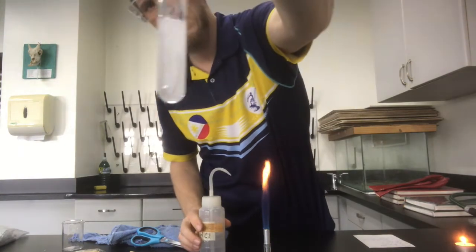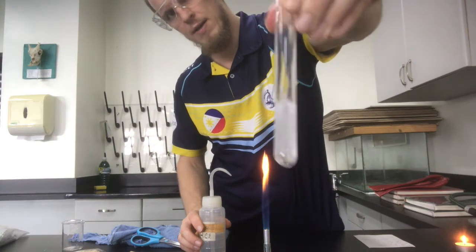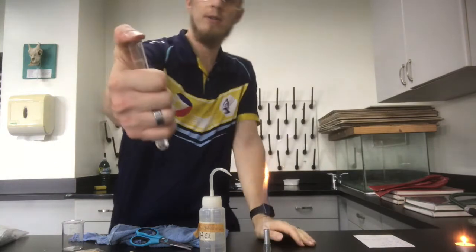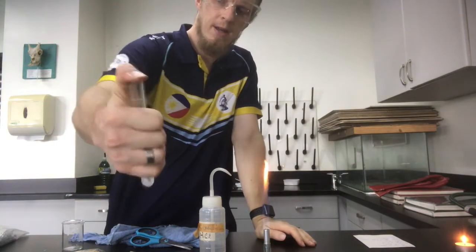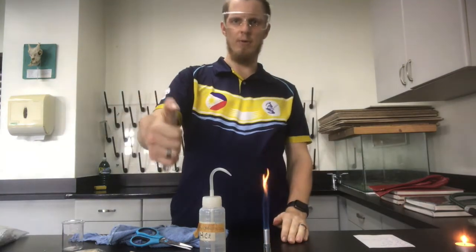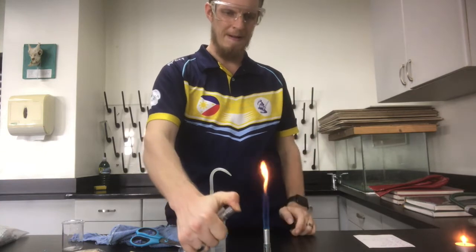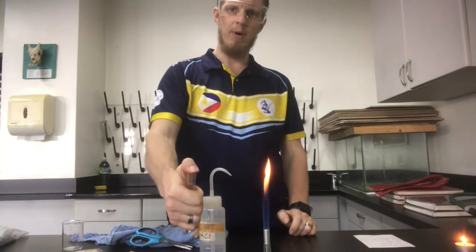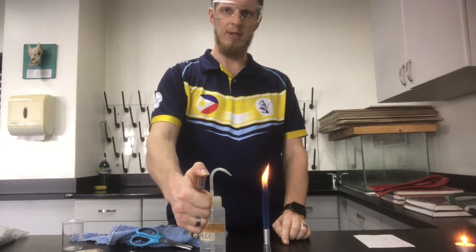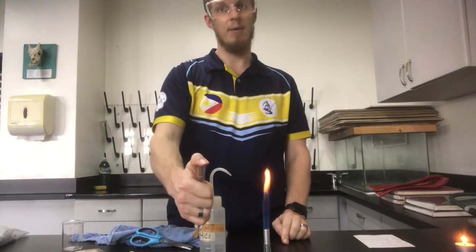Okay, so you can see it's quite clearly fizzing away there. Try not to burn my arm. What I'm going to do is hold my thumb on there, shake it up, and essentially what I'm doing now is trapping all the hydrogen gas, and if we listen very carefully we should hear a pop. That pop noise, and you can see the flame kind of be disrupted, is the hydrogen gas burning, which is actually a combustion reaction as well.